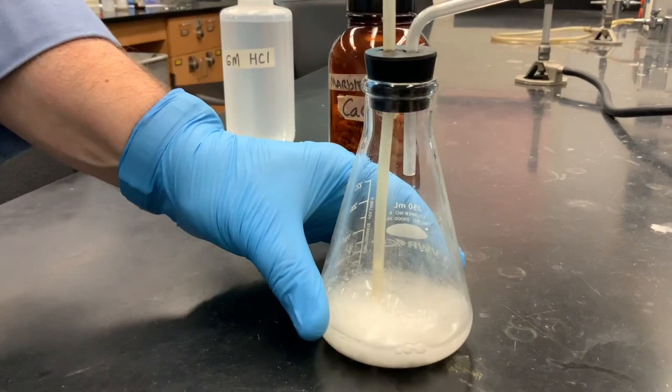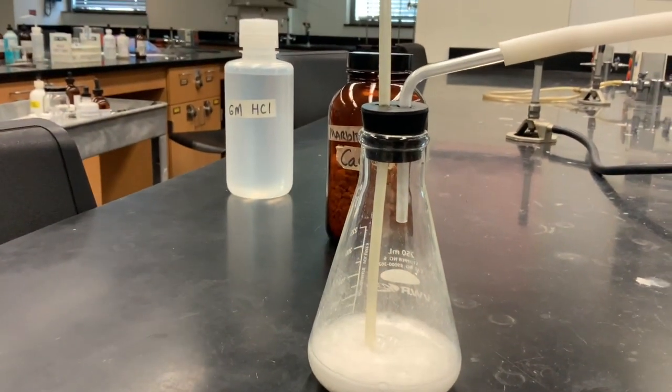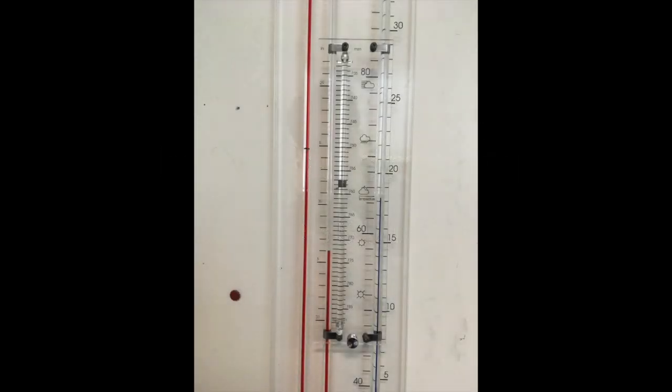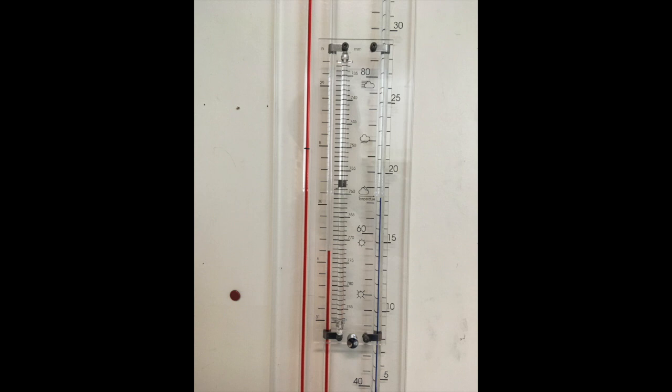Our job here is to produce a steady flow of CO2 gas and to fill flask B. While we wait we can take the barometric pressure reading. The barometer is located on the wall in the laboratory and consists of a U-tube of red liquid shown by the two tubes on the left.